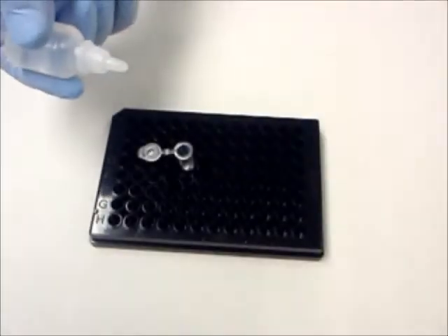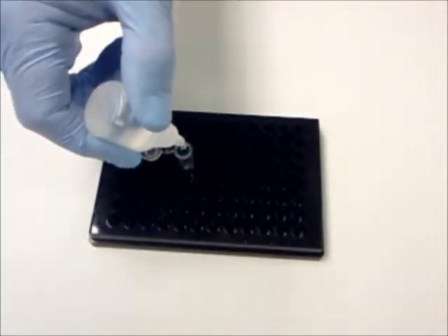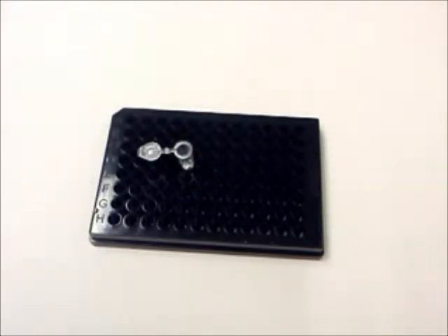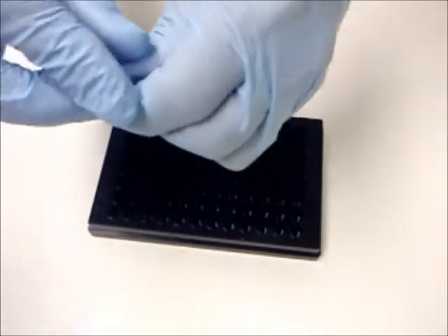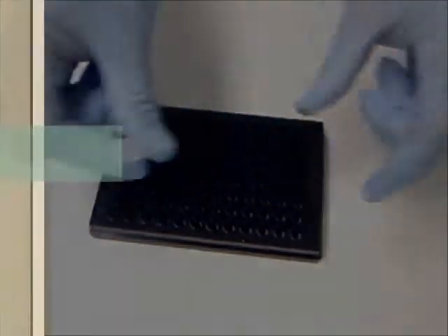After 10 minutes, add 2 drops of Reagent A, the substrate, into the plastic mixing vial. Secure the cap and gently shake to mix the solutions. Wait 10 minutes. During this time, Reagent A will be reacting with the bacterial enzyme, if present in the sample.